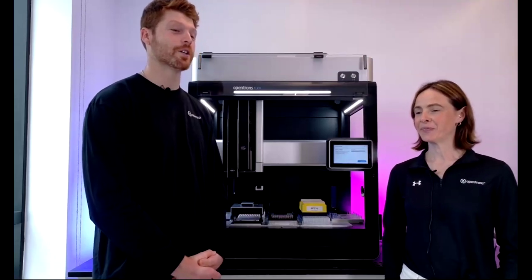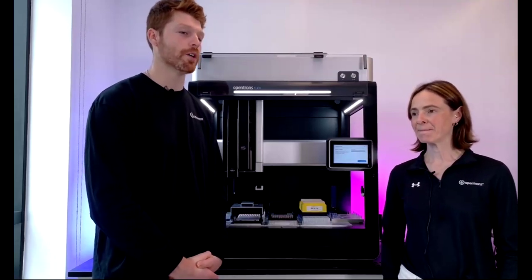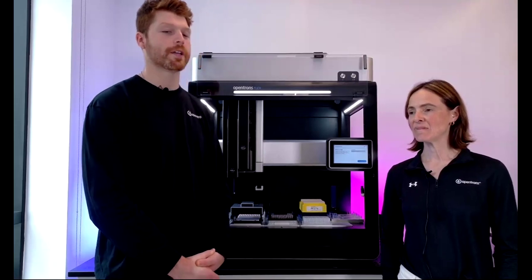Great. What about the level of precision for the P50 in normalization protocols, for volumes lower than 1 microliter, i.e. nucleic acid extraction, sample normalization, sample preps? Thank you. Also, we have about 30 seconds left. Sorry to rush. So for the P50, we do not support volumes below 1 microliter right now.